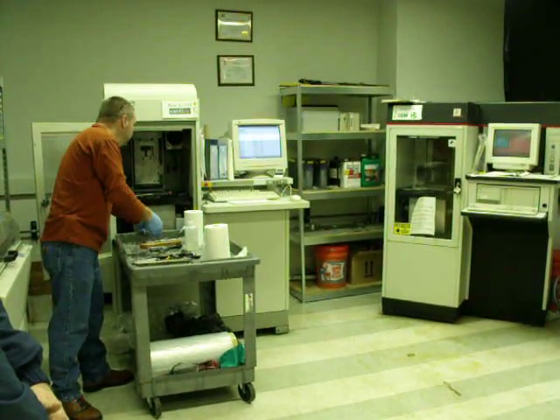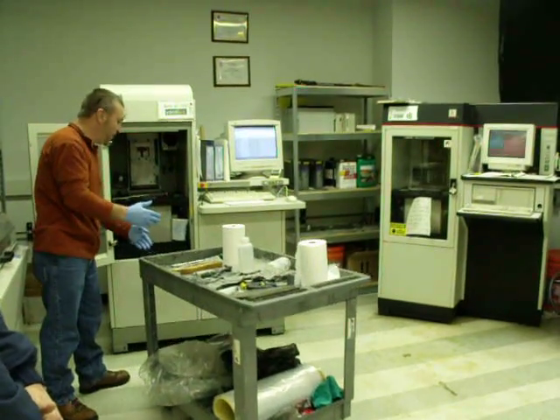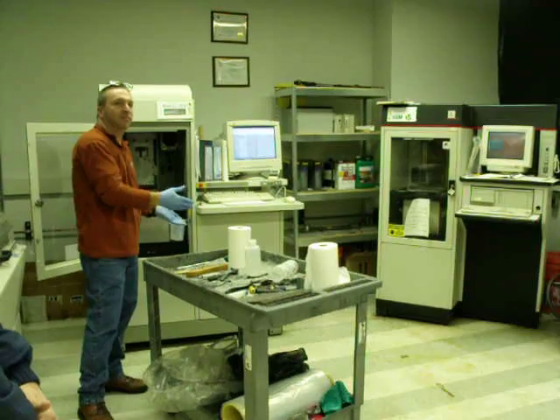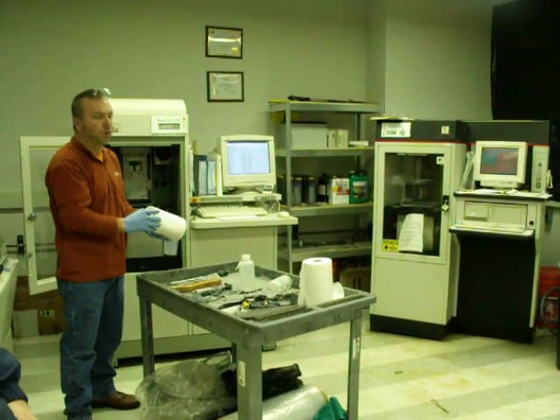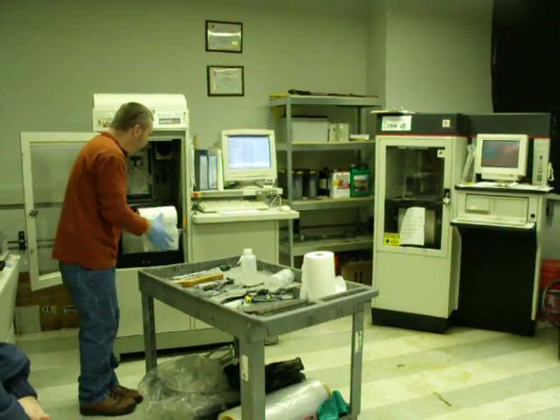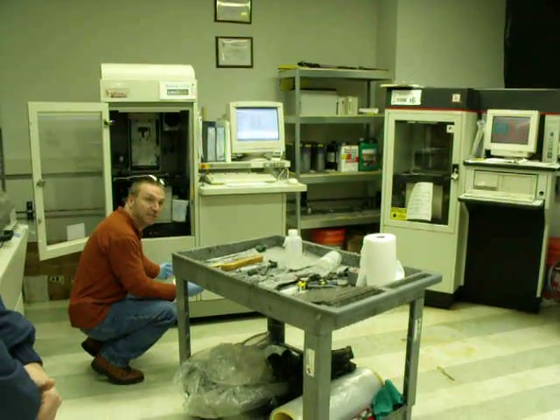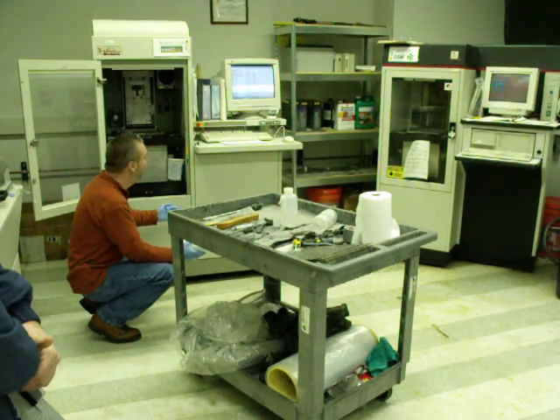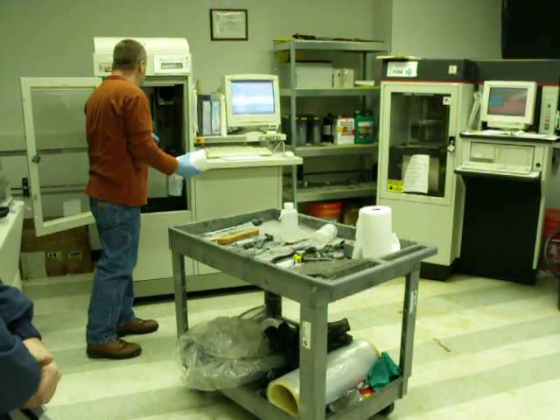Now, occasionally, there is that little gap. Occasionally there is the outside chance that it does drop on the floor. Well, if you look and you see resin on the floor, you simply get this paper towel and some isopropanol and you wipe it up. The outside of the machine, there was resin. It had been dripping and running all down the side of the machine. That's unacceptable. There was resin, and there still is, all over the frame of the machine.